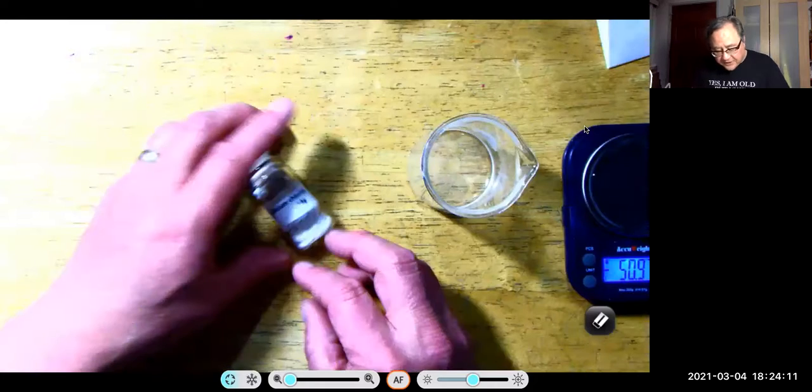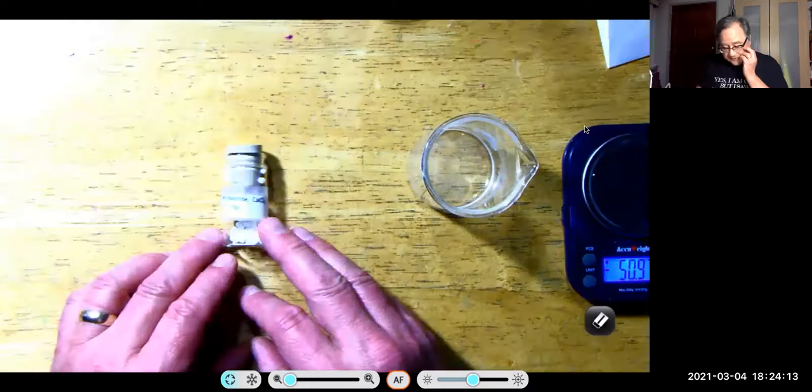If I did stir it with my stir rod, I'd pull my stir rod out and I'd swish it down with a little bit of water to rinse all of the solution back in. Okay, so there's my carbonate dissolved. Now what you want to do is you want to figure out how much calcium chloride you're going to need so that you have excess.